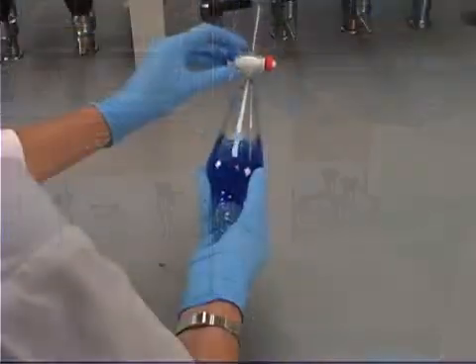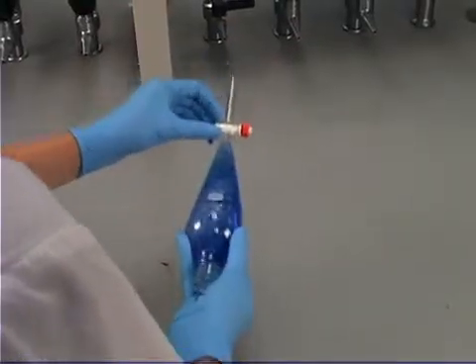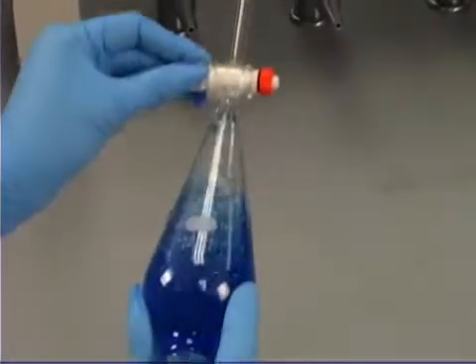For macro scale extraction, a separatory funnel is used. Supporting the stopper with your hand, shake to mix the layers.